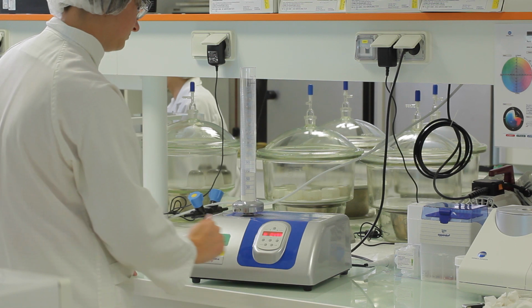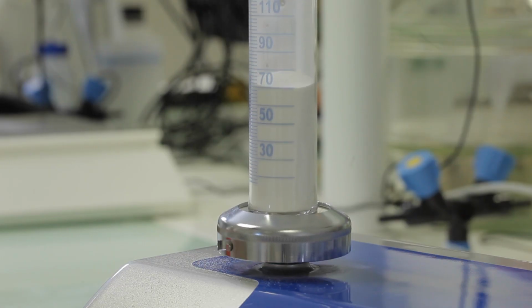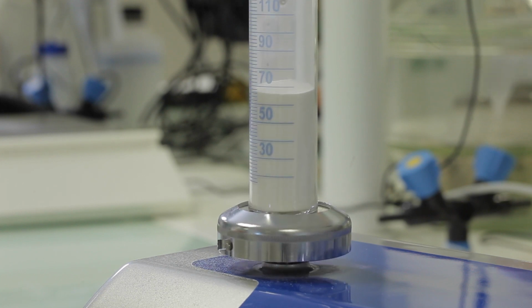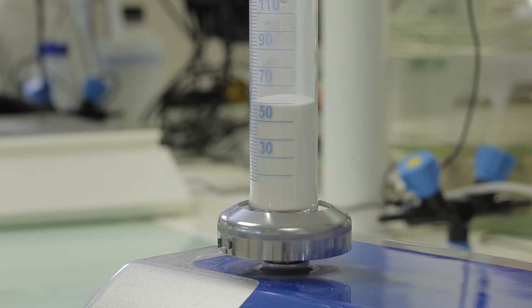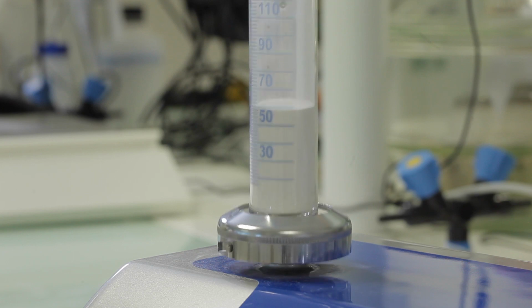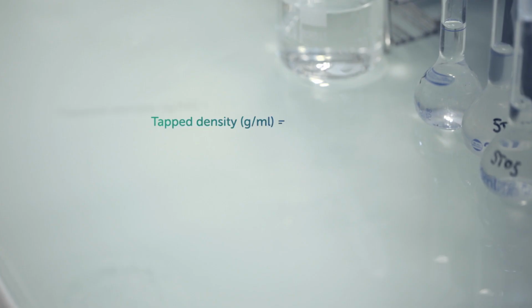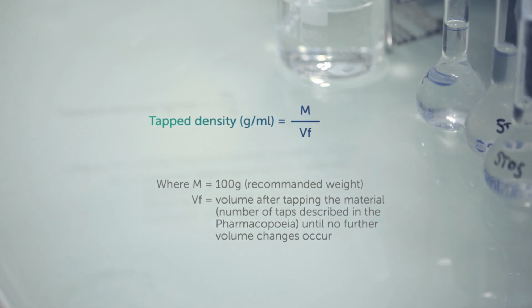Tapped density is the density after mechanically tapping the powder as described in the Pharmacopoeia method. The cylinder containing the lactose powder is placed onto a tapped density meter and tapped a set number of times as the method describes. The material level in the graduated cylinder is then measured and tapped density calculated.